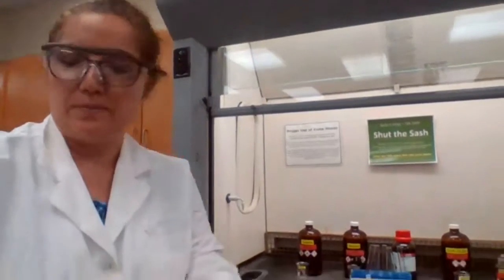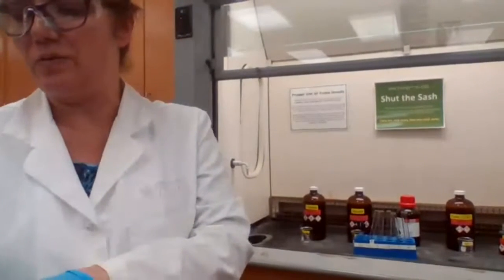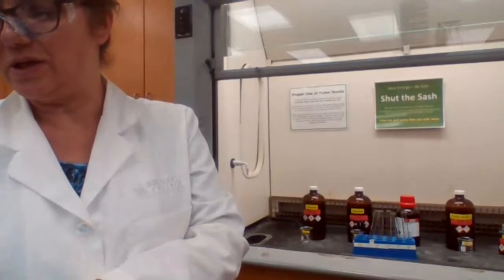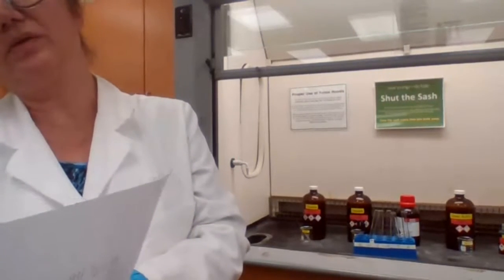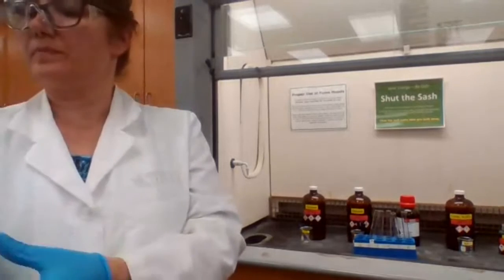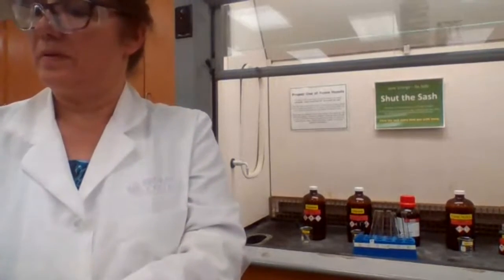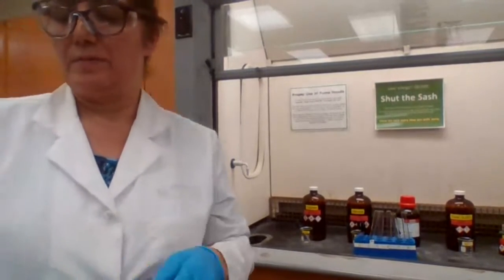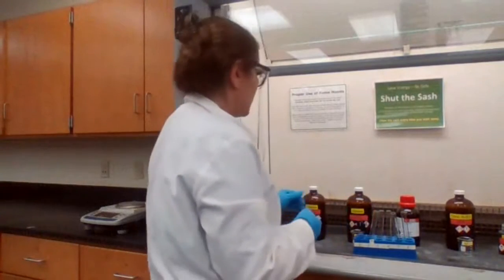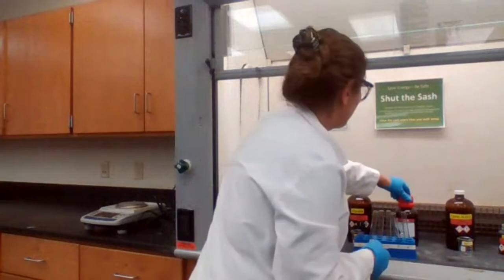So, can you tell me how much I should add? What should I do? What's the first step?